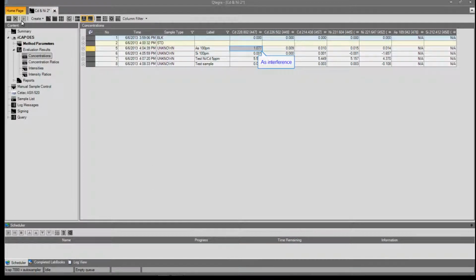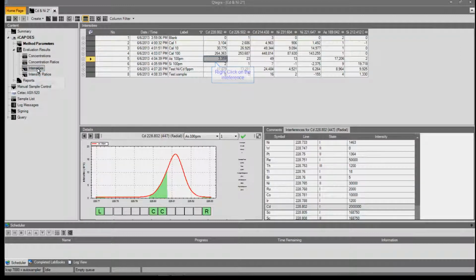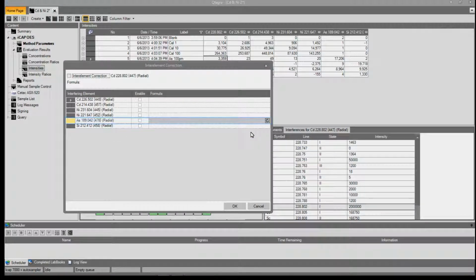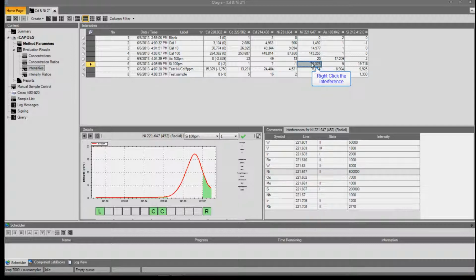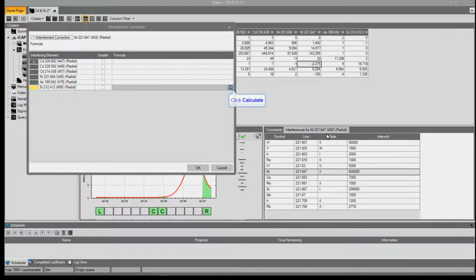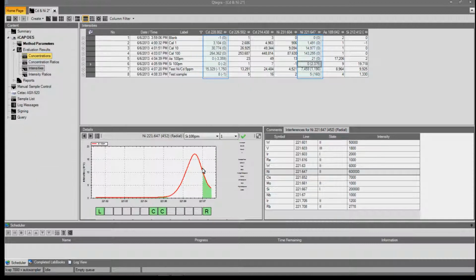As we can see, the cadmium 228 line has a clear arsenic interference and the nickel 221 line has a clear silicon interference. To remove this, we start by going to intensities, then right click on the cell containing the interference and select inter-element correction. Find the line for the interfering element and click calculate. And OK. Again, right-click on the cell containing the interference and select inter-element correction. Find the interfering element and click Calculate, then OK.